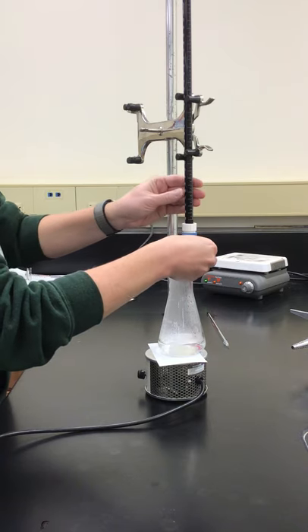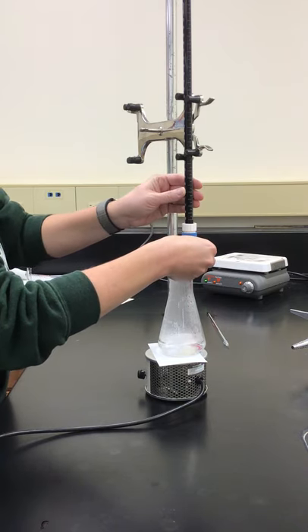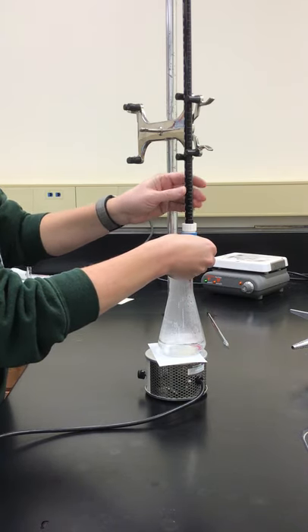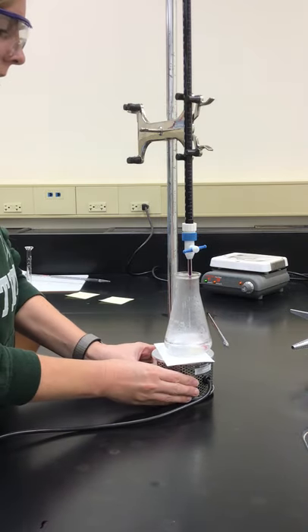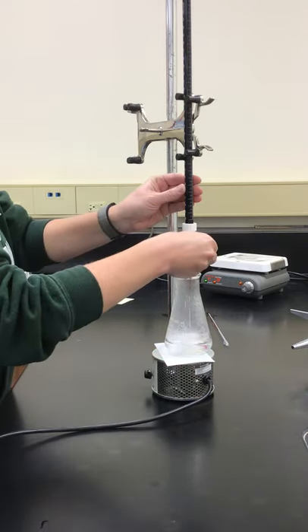And then we're going to start to add our potassium permanganate until we see that light pink color emerge. Get that lined up. Here we go.